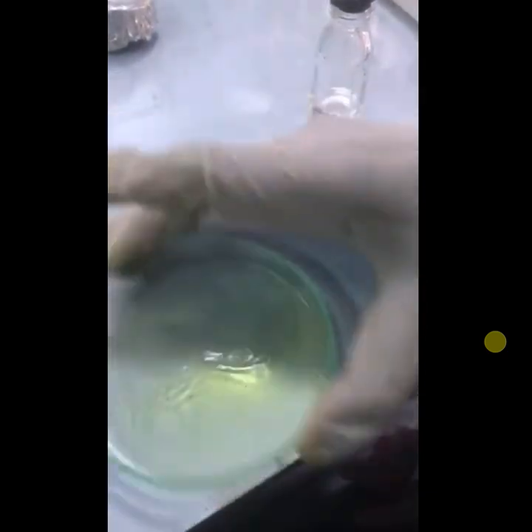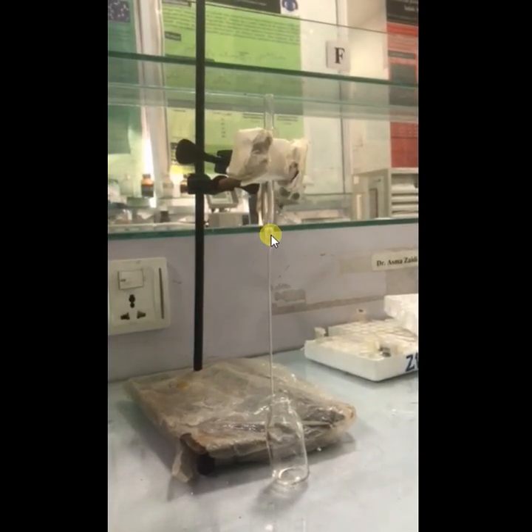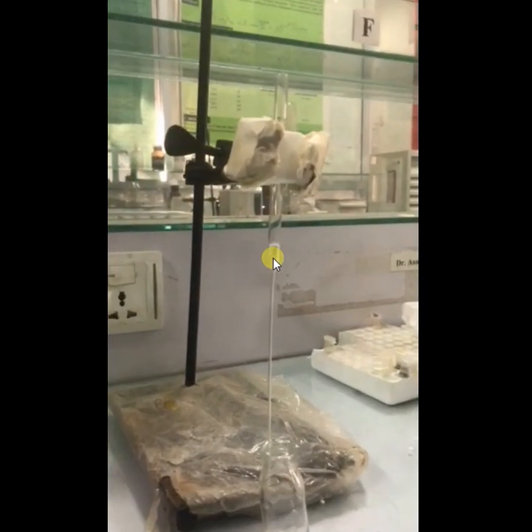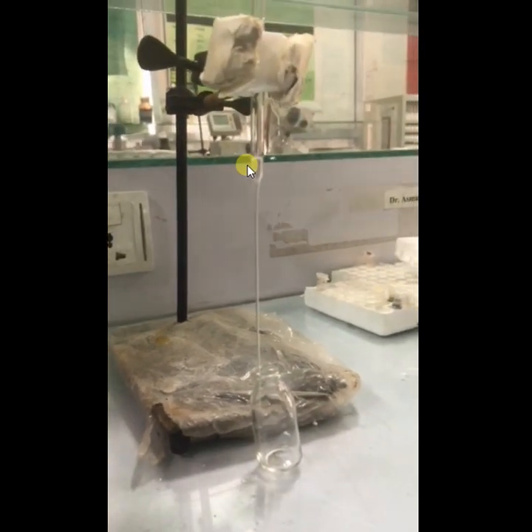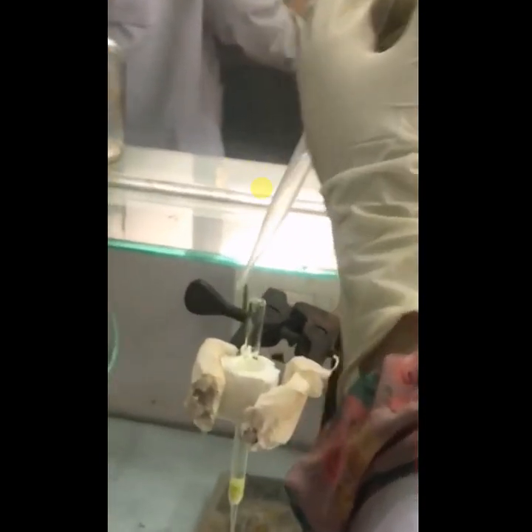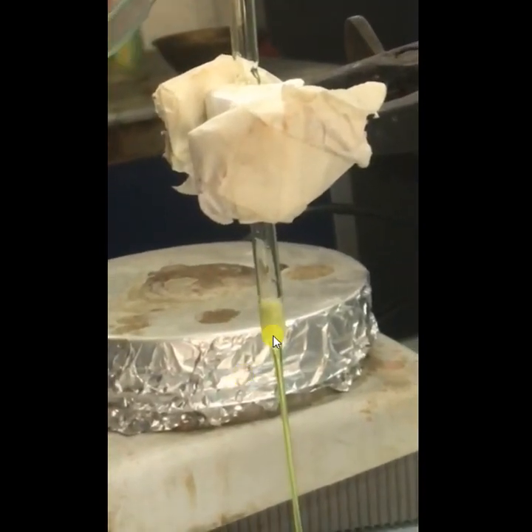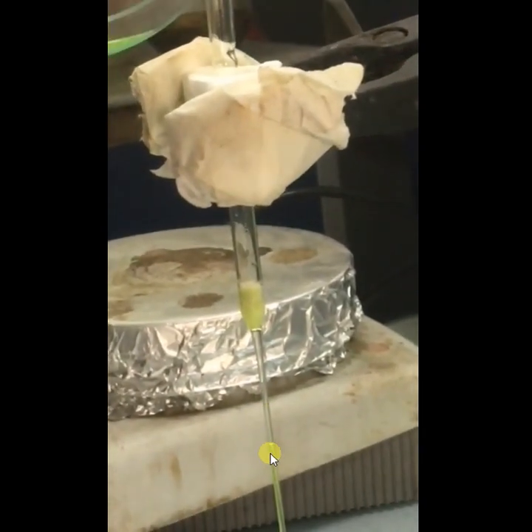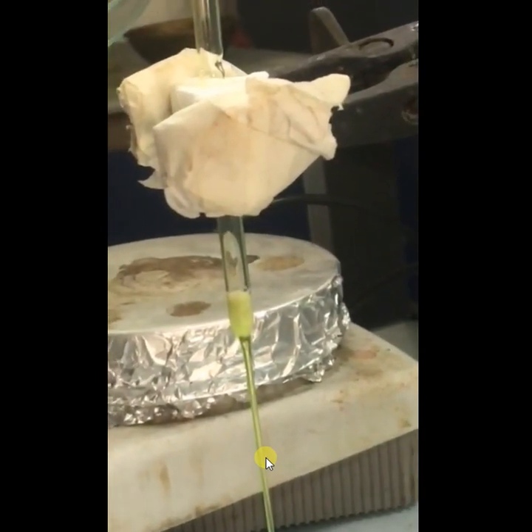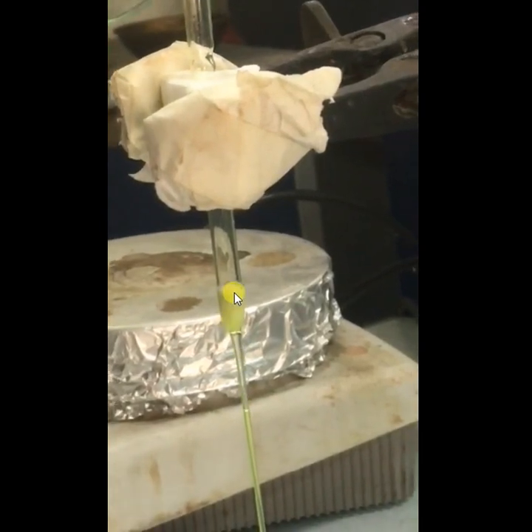As you see here, there is a little bit of cotton present. By placing cotton here, the silica that was present on the TLC plate will remain here, and my product will be separated. All the silica remains here and my pure product will be separated.